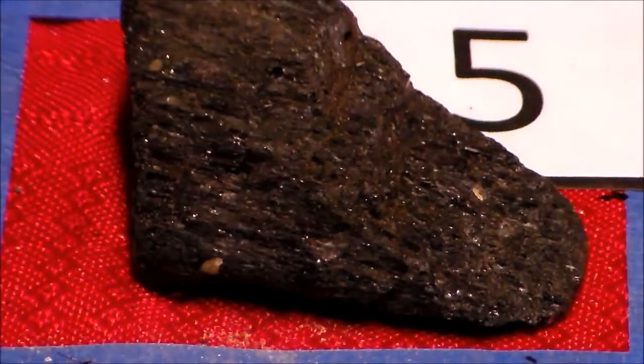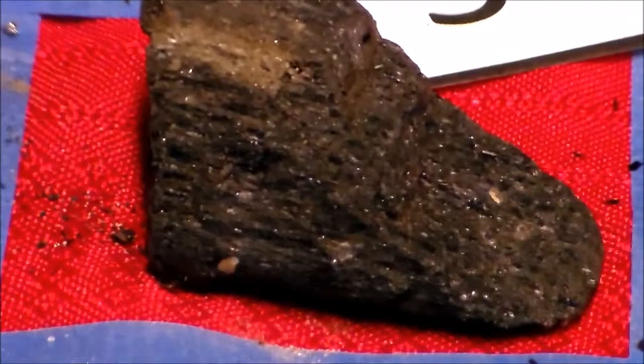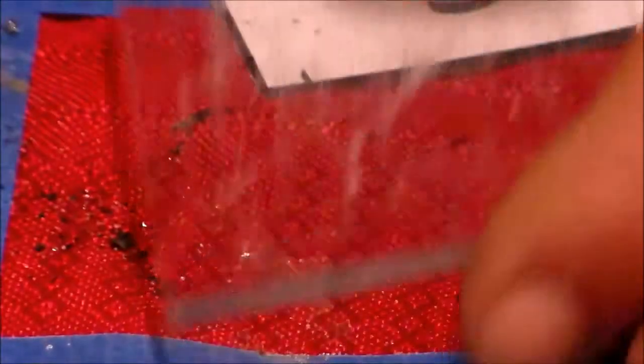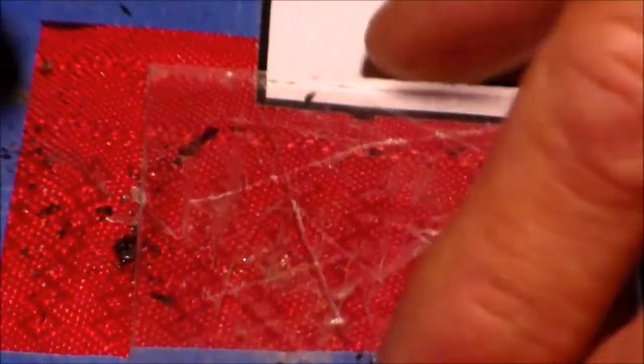Let's check out the hardness. Can I scratch it with a penny? Nope, it takes the surface off the penny, so we know it's harder than a 3. Looks like it will scratch with a nail. So check your Mohs hardness table and see what scratching with the nail would do. Has to be pretty darn hard to scratch glass, so let's see if it'll scratch glass. Nope, it just crumbles, turns into a powder. So it will not scratch glass.